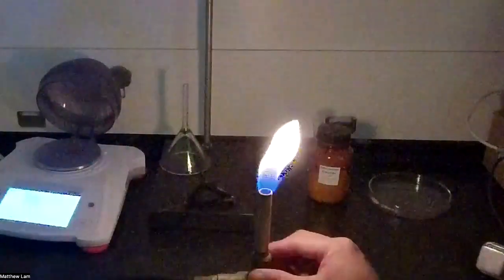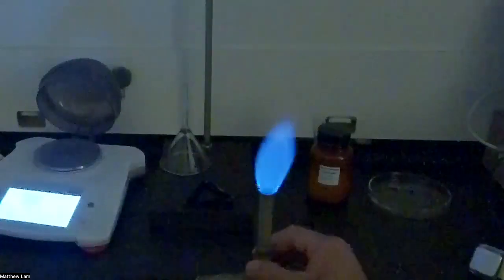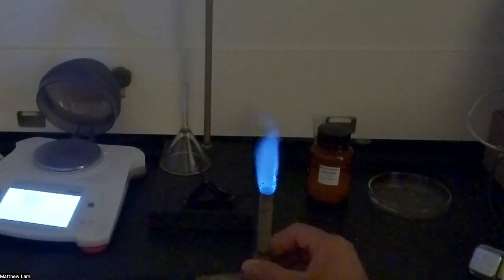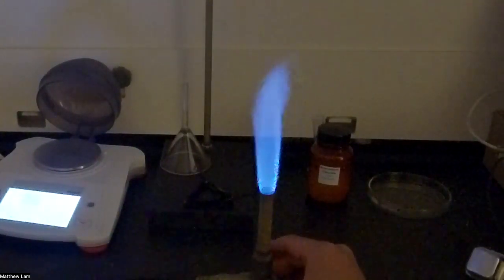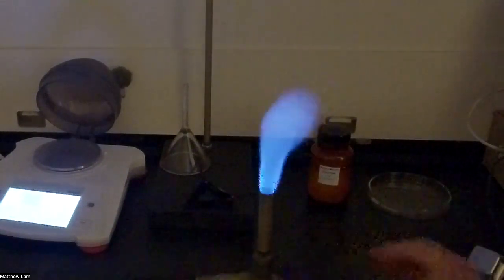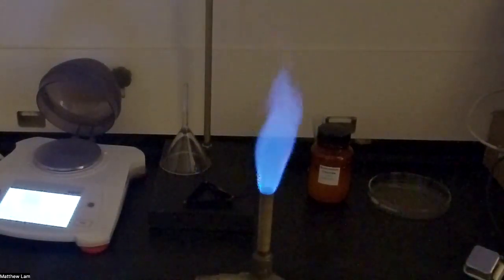And so if I change the amount of oxygen put into it, it goes from an orange flame to a more blue flame. Now, blue is a hotter flame, and so we can increase that or decrease that. We have a blue flame here, so blue is hotter. We're going to use this type of flame for this experiment.